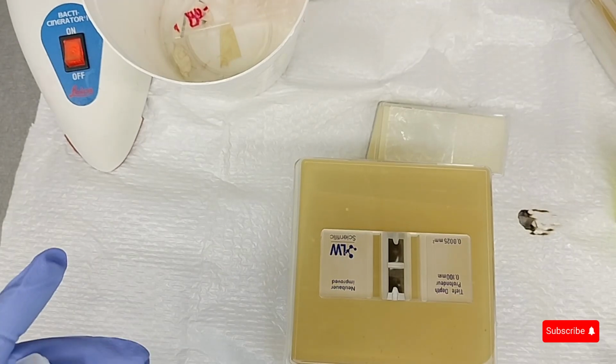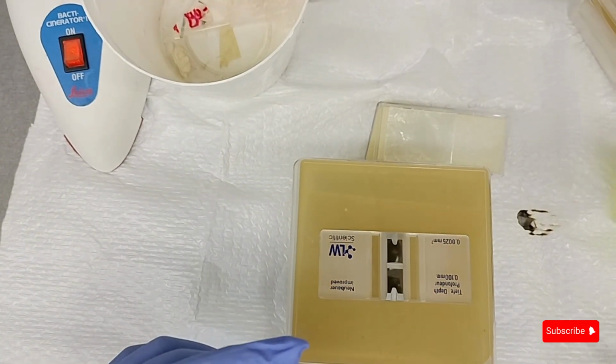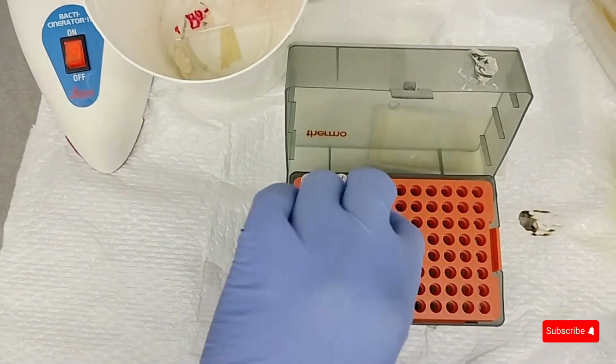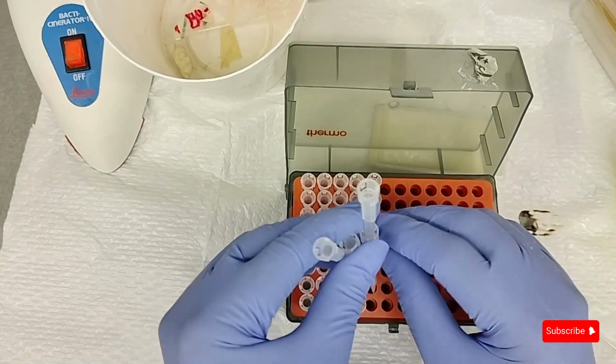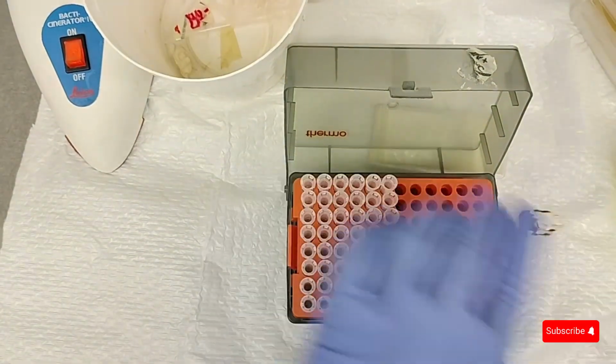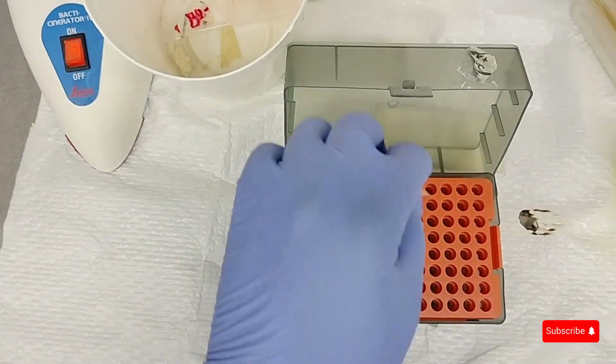That's the vial with the spores, and I'm just going to quickly flame them once I put the tip onto my pipette. I accidentally knocked over the pipette container, so I have to manually put them all back into the box. It's a good thing that I'm working in a sterile environment, so it's fine.